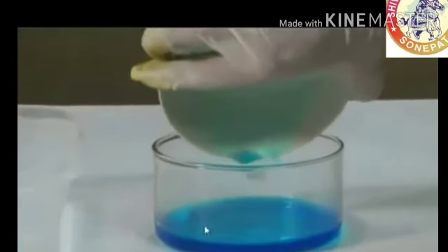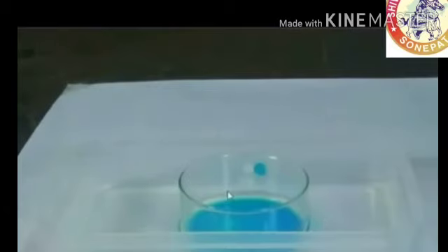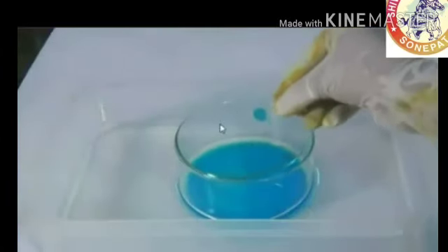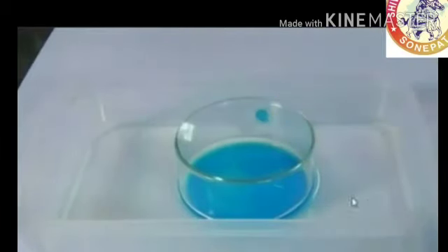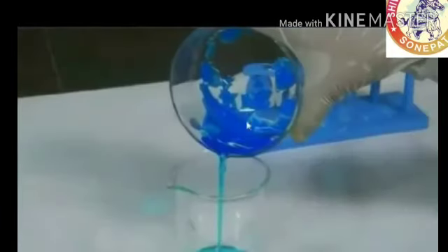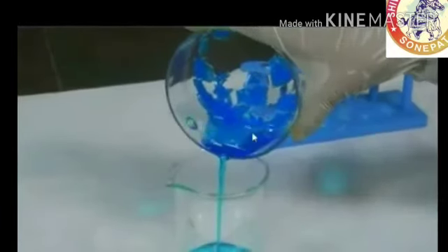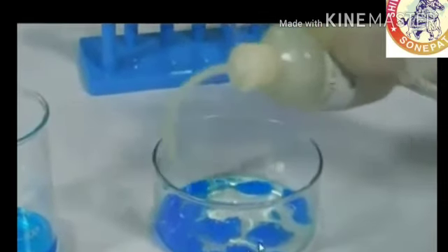When we get the solid substance on the glass rod, we stop the heating and pour all the liquid for crystallization into another beaker, and cool the mixture slowly by covering it with glass. Leave the solution overnight, and after 6 to 8 hours, we get pure crystals of copper sulfate.